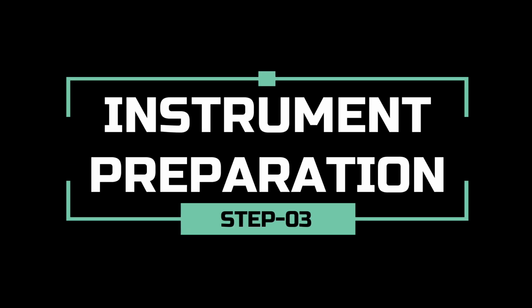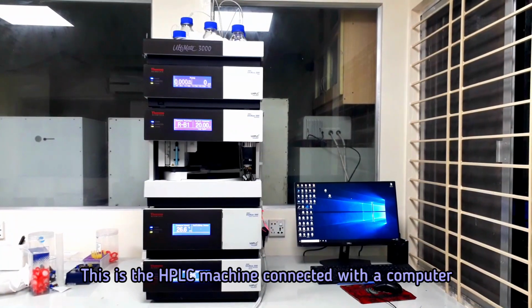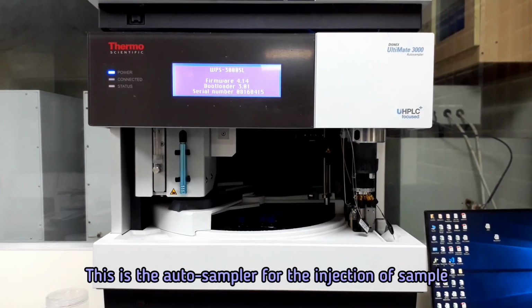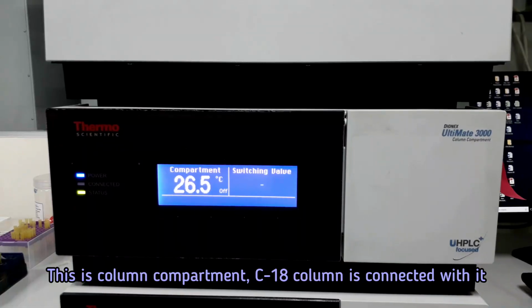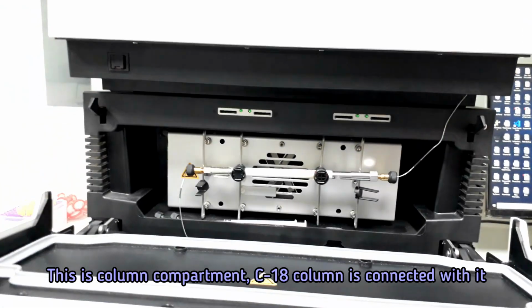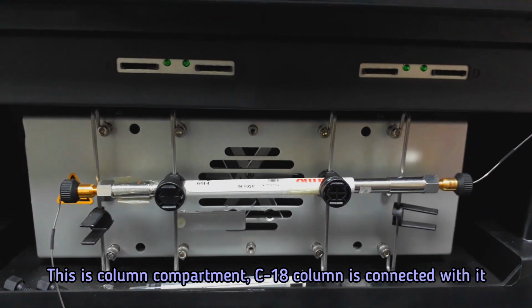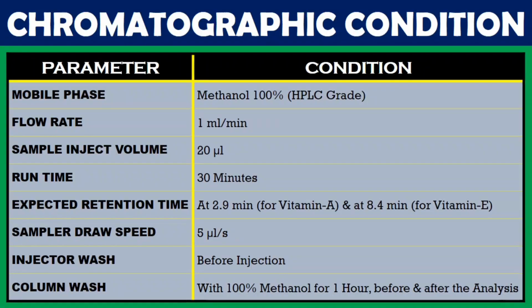Let's go for the instrument preparation. Instrumental conditions are shown in the display. So let's set the HPLC system accordingly. This is the HPLC machine connected with the computer. This is the auto sampler for the injection of sample. This is the column compartment and the C18 column is connected with it. This is the UV-VIS detector chamber and this is the data acquisition software.